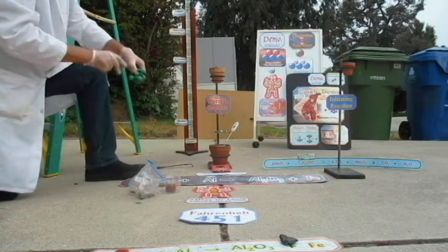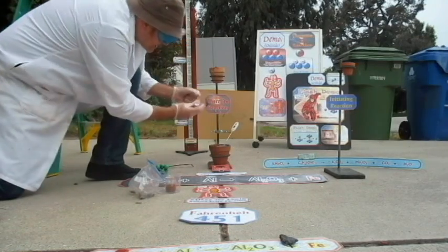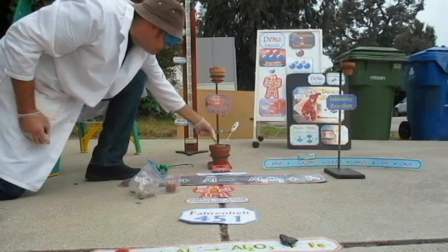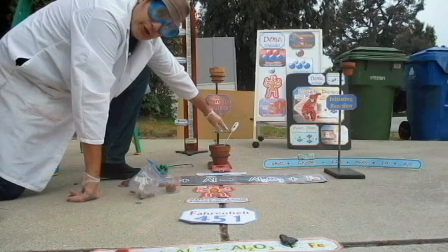So it's hard to use a thermometer. We don't usually, oh, and I've got a little piece of this right here. This is the same as a small one. I think it'll be easier to melt a small one. Another thing we're going to do is have an actual thermometer. We don't usually do this.